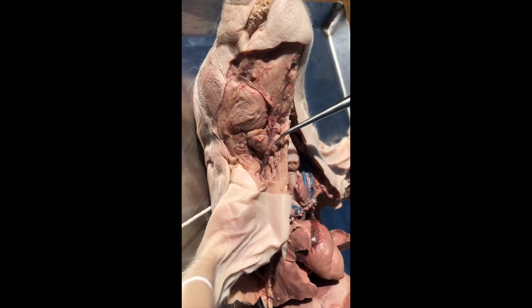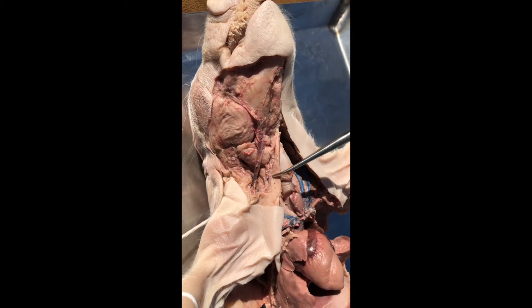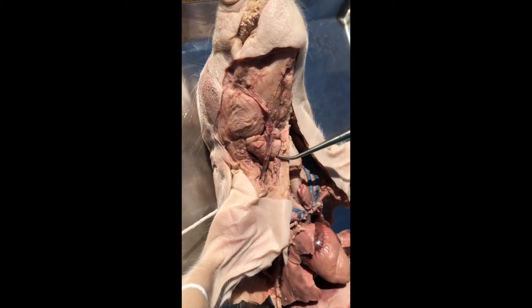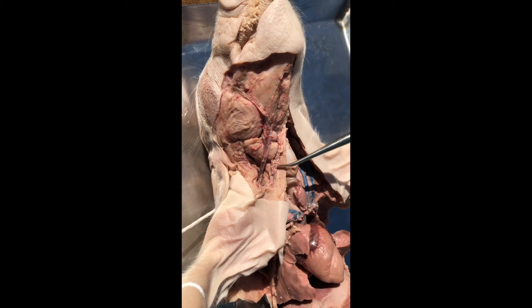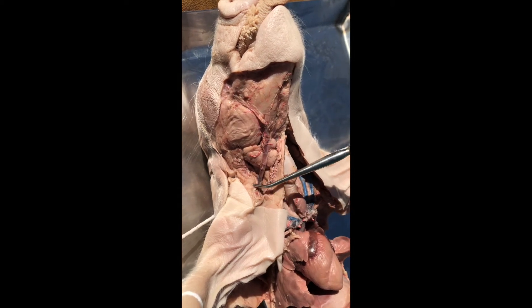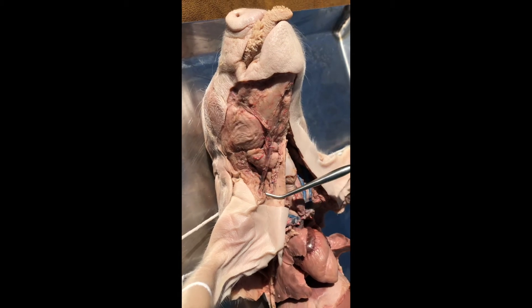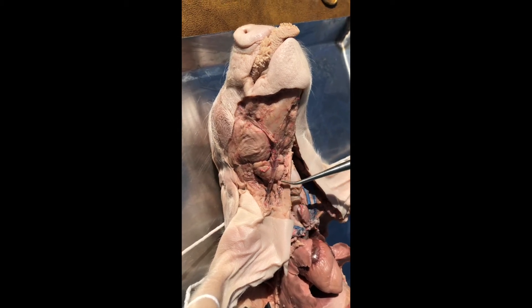That's one of the salivary glands, this one's another, and then what's left of the other one — because it really sticks to the skin. This stuff that looks like cottage cheese, that's beige — that is some parotid gland. There's a little bit of parotid gland up here, and that would have been laying on this whole surface right here. Parotid gland is one of the salivary glands.